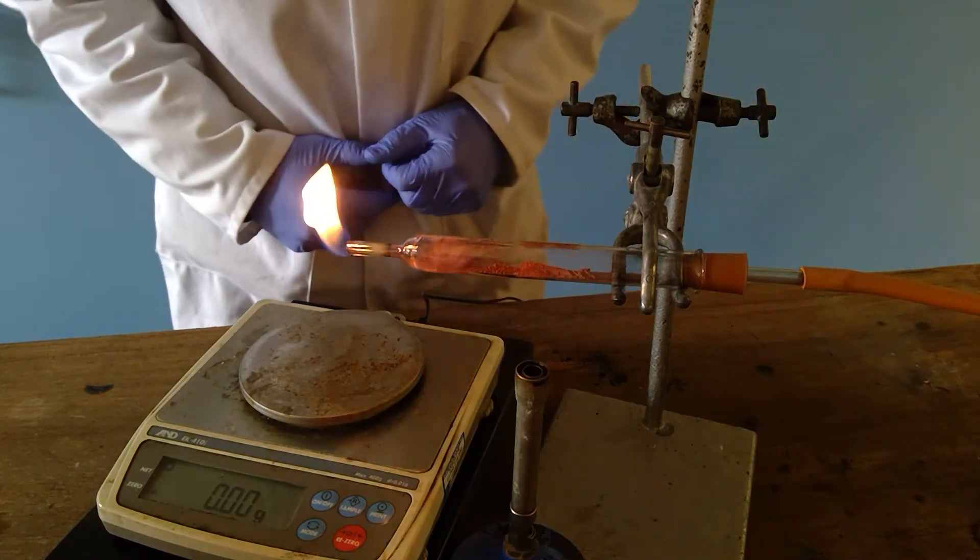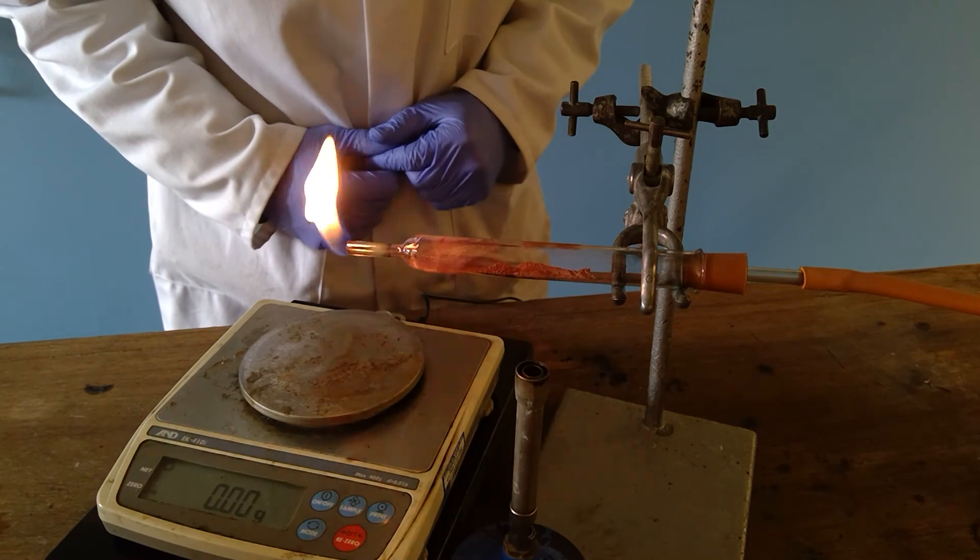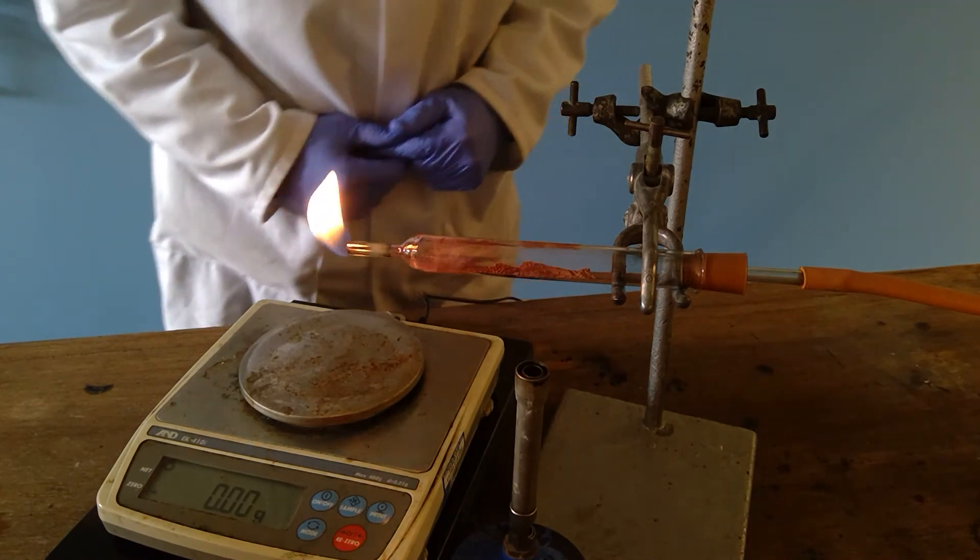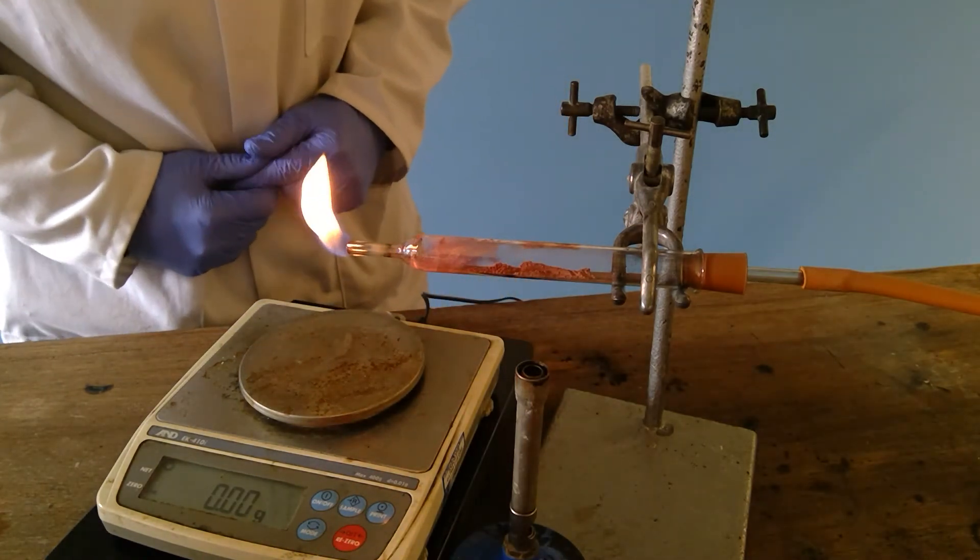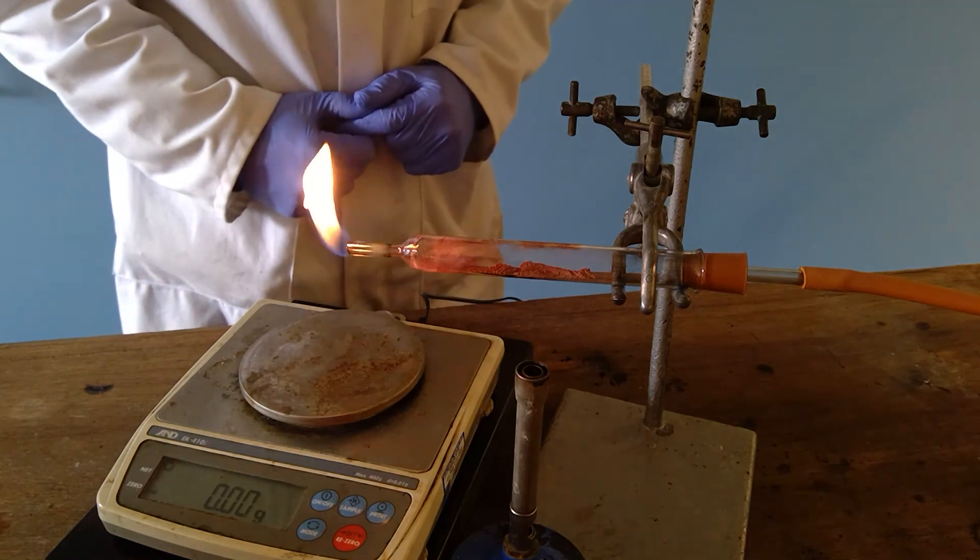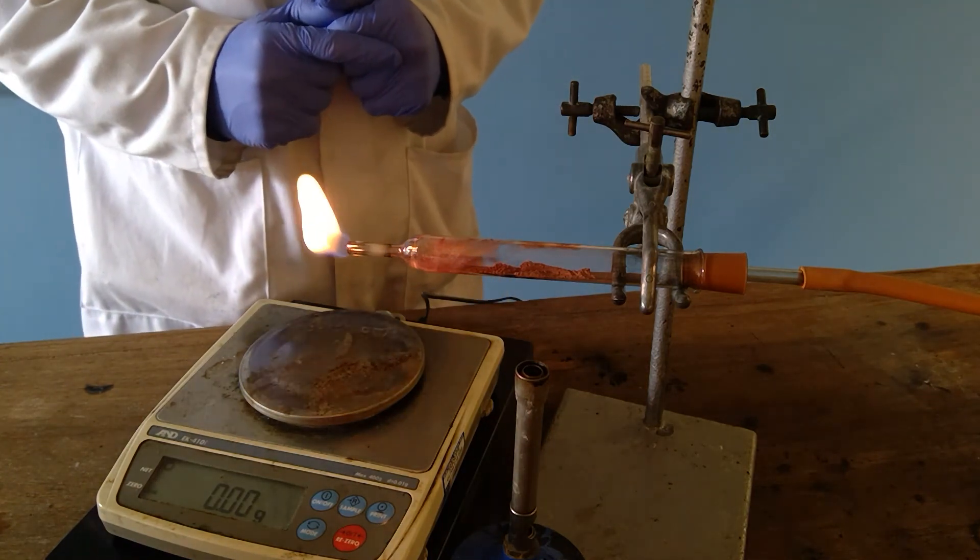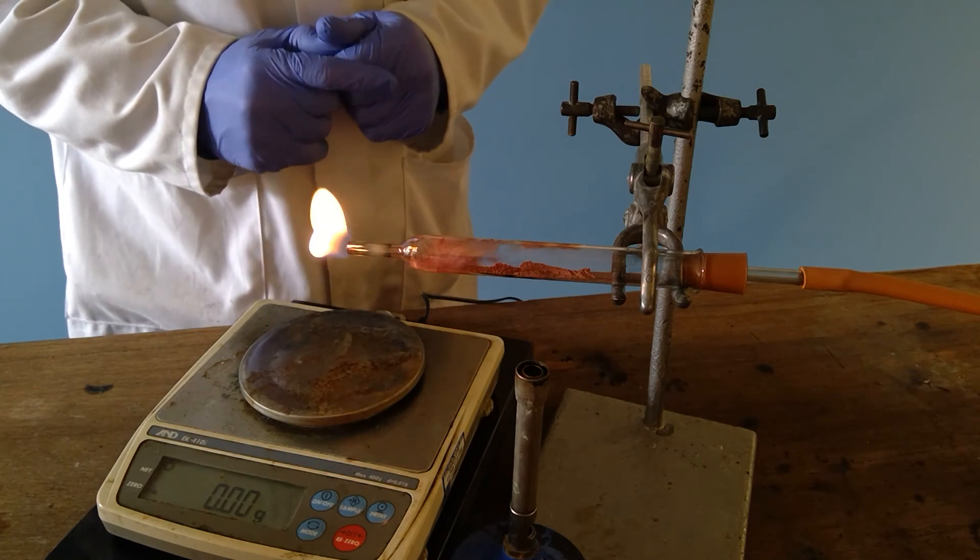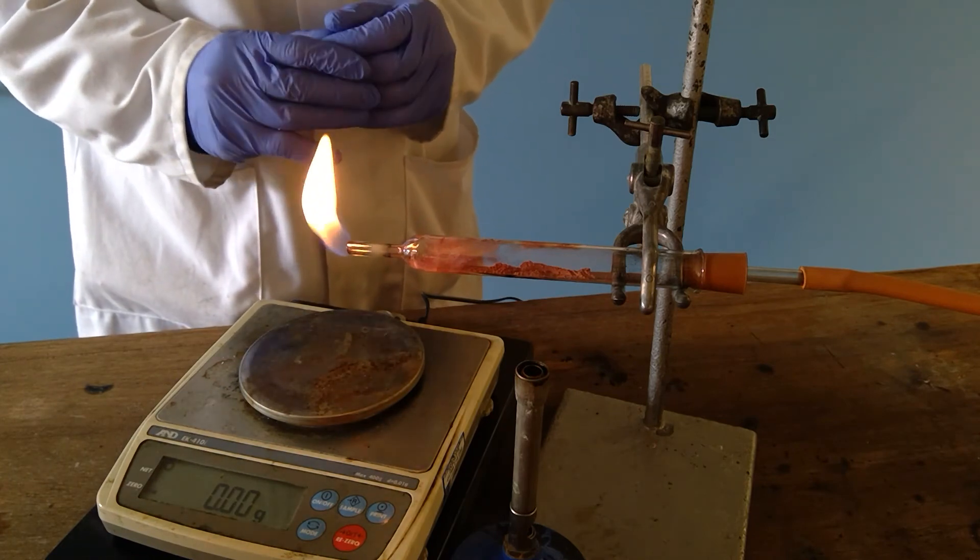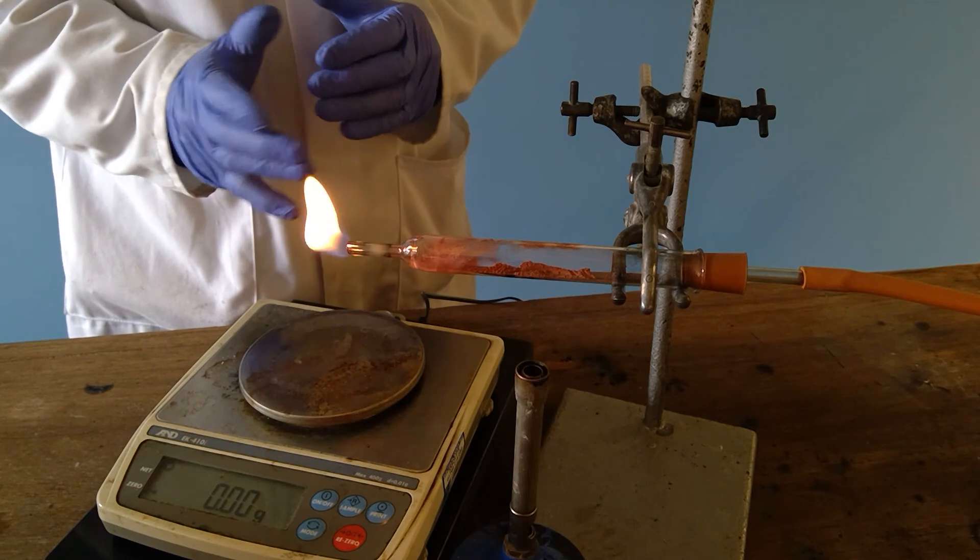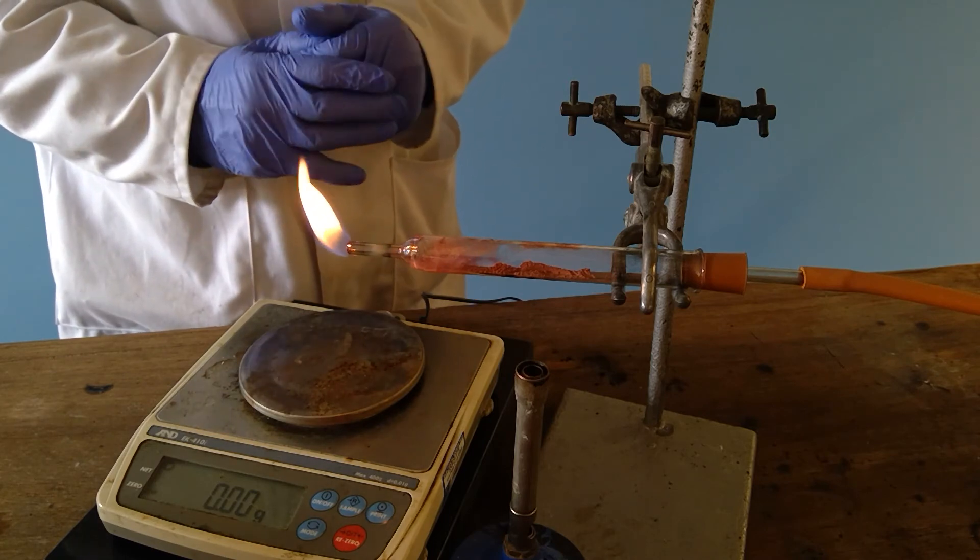And as you can see there is plenty of copper having been formed but maybe also some signs that there may be a little bit of black copper oxide left. So we need to leave this until it has cooled sufficiently that the copper will no longer react with the oxygen in the air. This is difficult to judge but we will leave it for a short while.